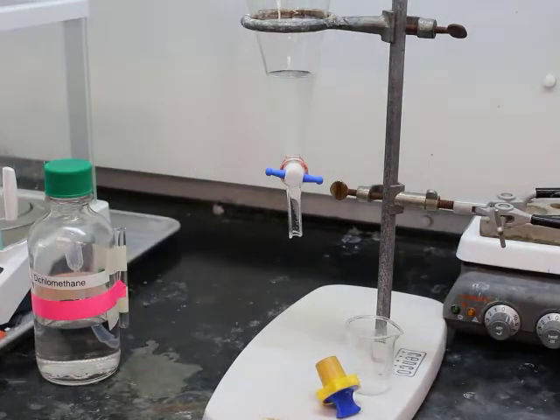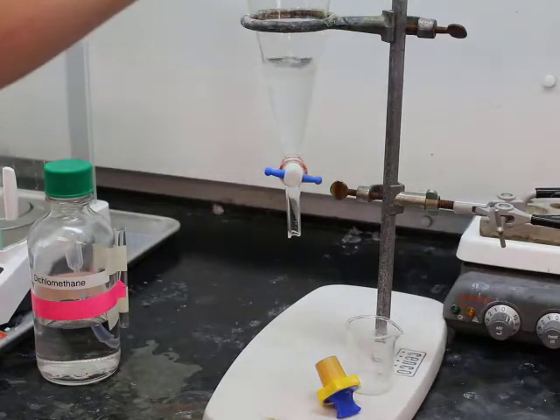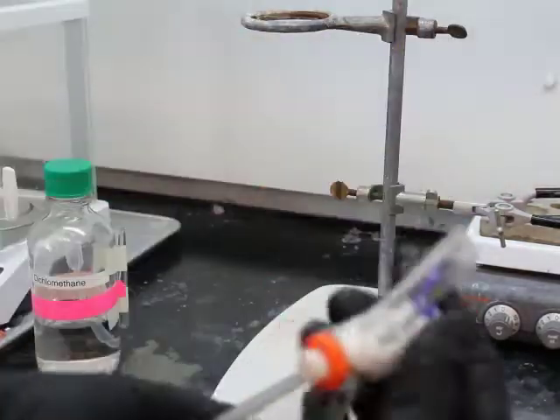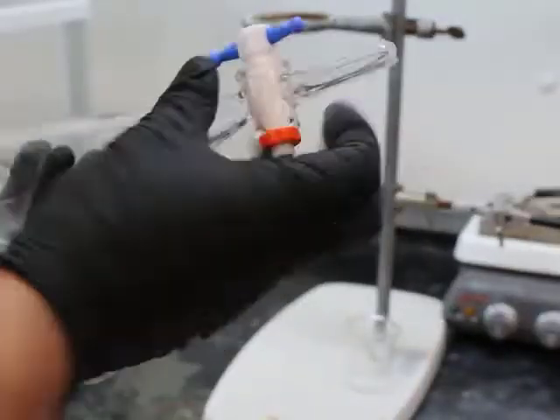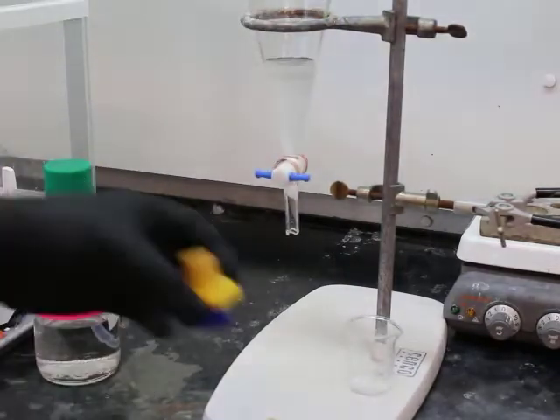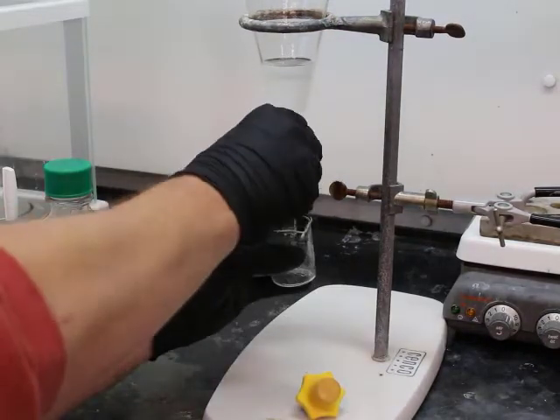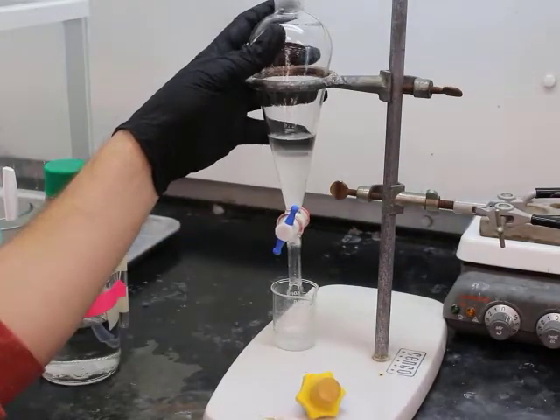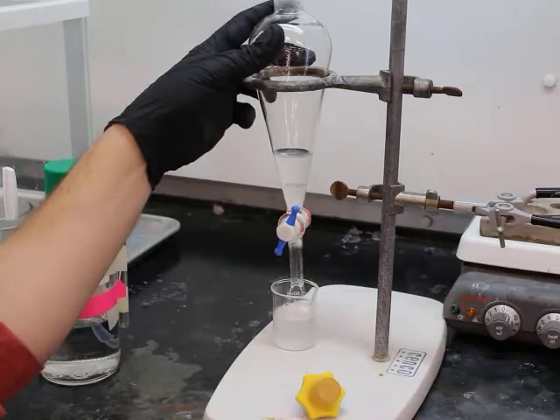Alright, and then separated out the basic layer, put our organic layer back in that separatory funnel, and so now we're going to perform the sodium hydroxide extraction. Here we're doing it a second time, so shake, shake, shake. Oh, you didn't know I could shake it like that, could you? I went hyperspeed on that one. Then going to allow it to settle, and then go ahead and remove the bottom organic layer again.